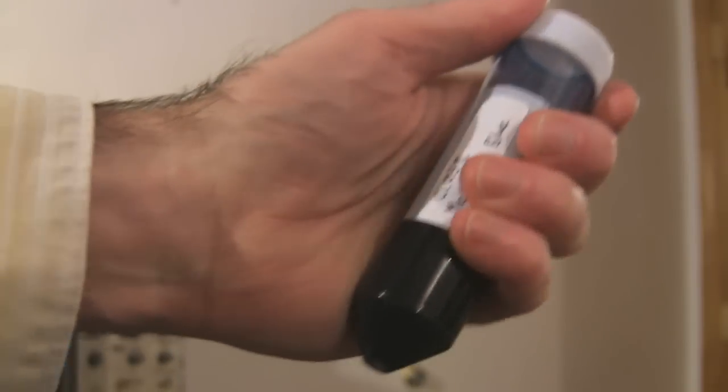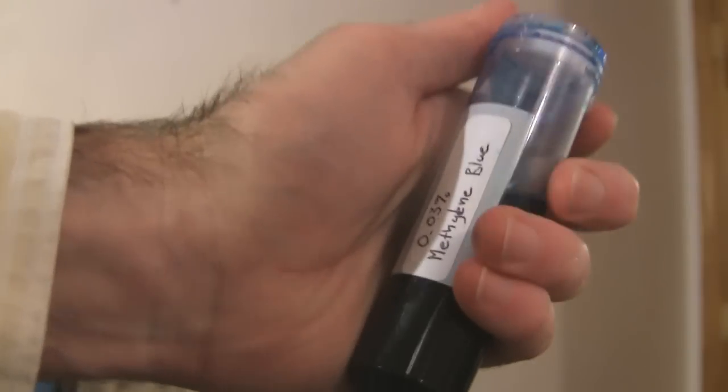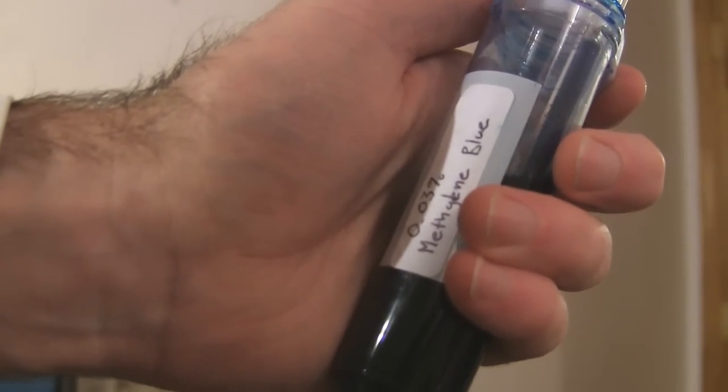You'll want to use a 1 to 1 ratio of 0.03% methylene blue to your sample.